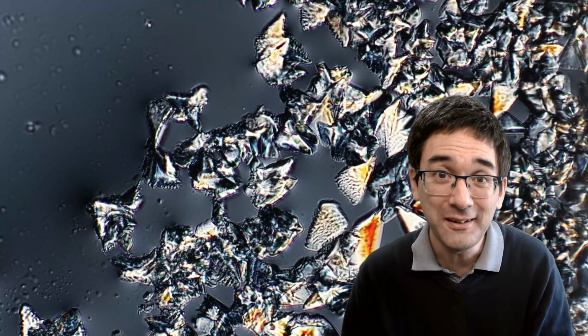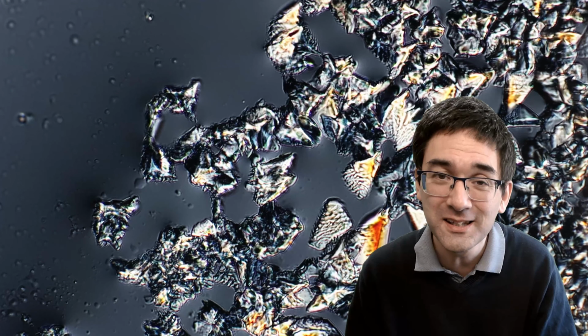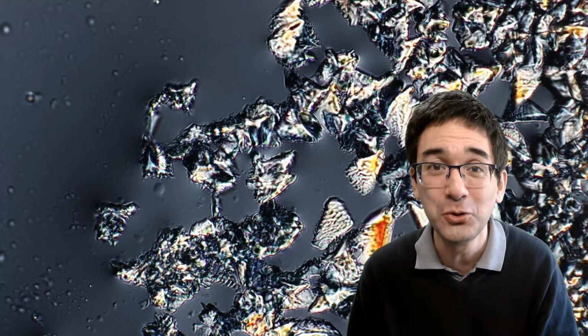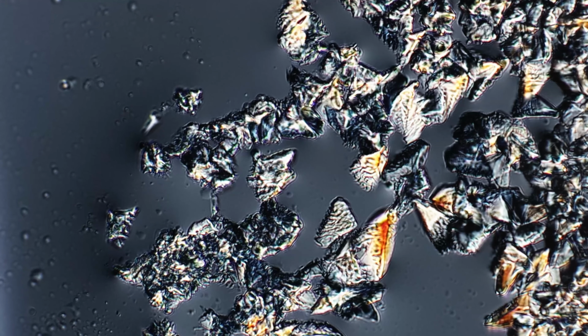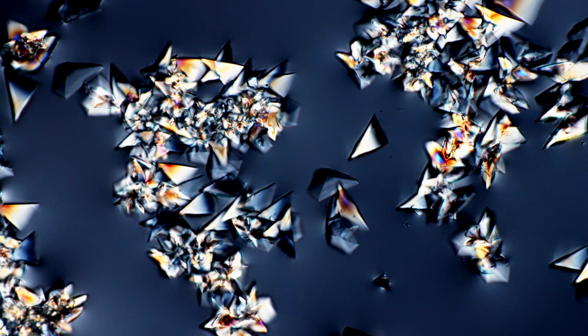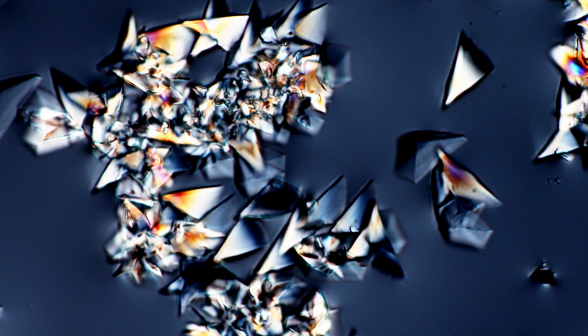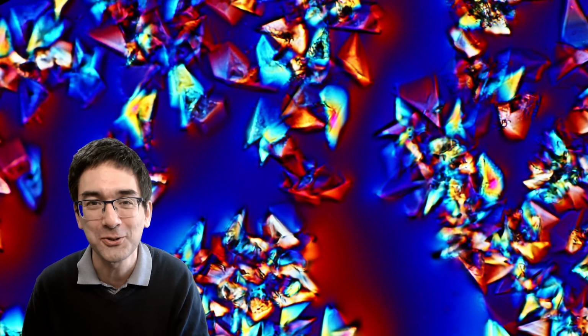Well, for today, I think that's it again. I hope that you liked this video again. I know it's a little bit of an unusual specimen, but you see there are so many things that you can explore with your microscope. There are plenty of ideas out there, and I would simply recommend just start experimenting, try out a few things. Nothing has to be perfect at the first try, but this is how we all learn. If things don't work out the first time, then you of course repeat the experiment, and then maybe you're also going to be lucky and you're going to get nice pictures like this.